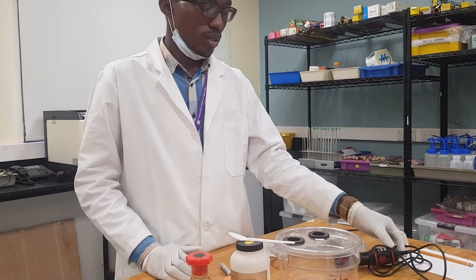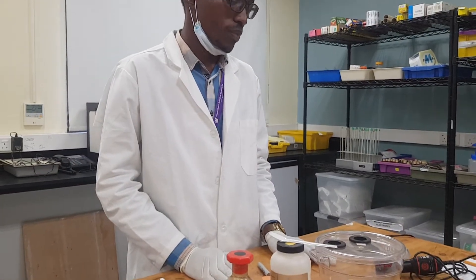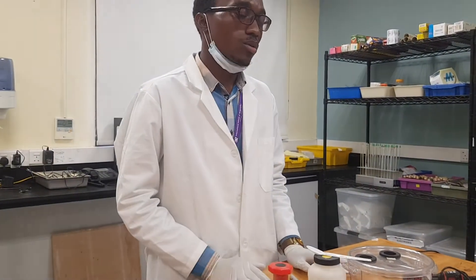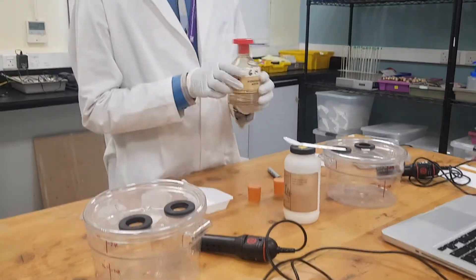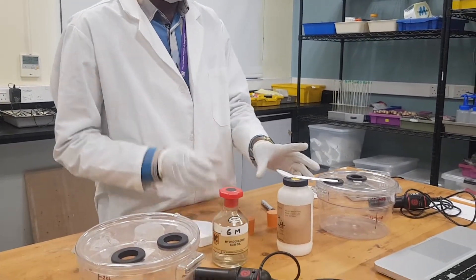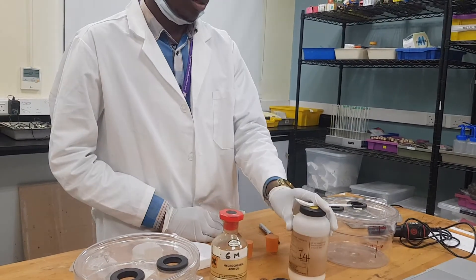We have different ways of having carbon dioxide. You can have carbon dioxide from respiration — you give out air which contains carbon dioxide — and you can find carbon dioxide from a reaction. So today we're going to collect carbon dioxide from a chemical reaction. We are going to react diluted six molar hydrochloric acid with sodium hydrogen carbonate, or sodium bicarbonate.